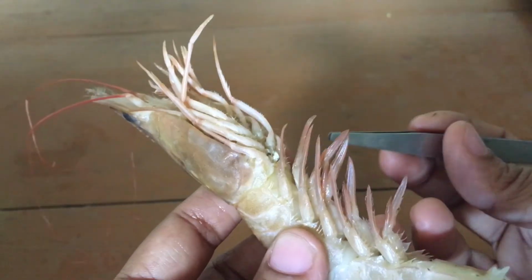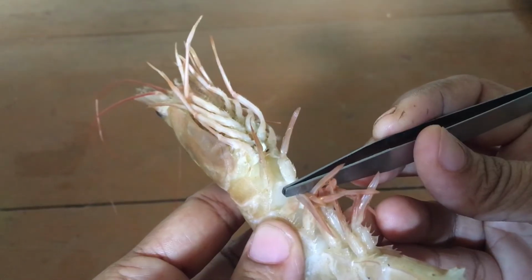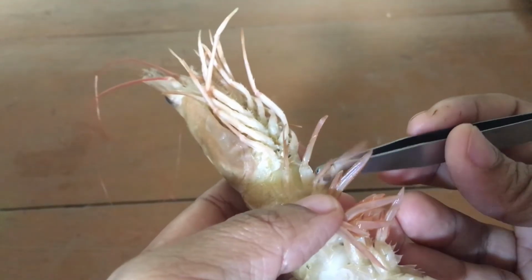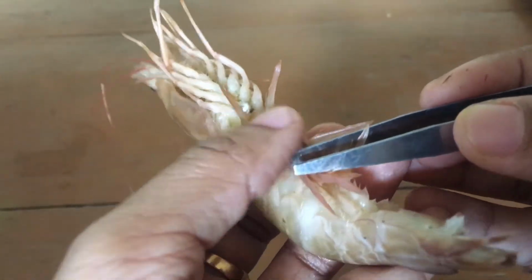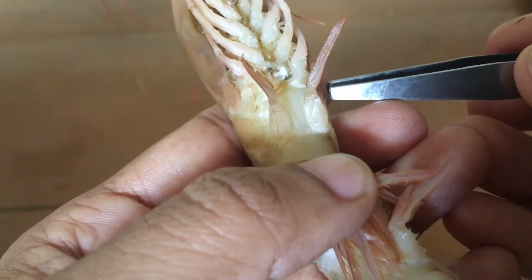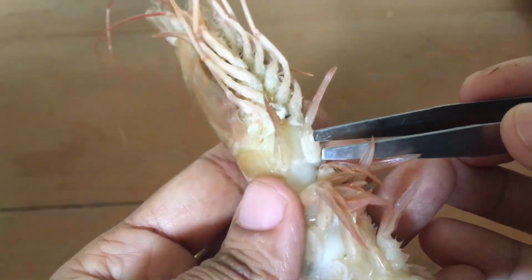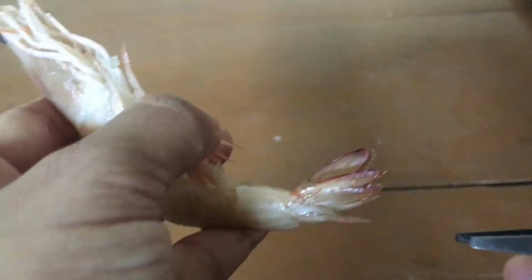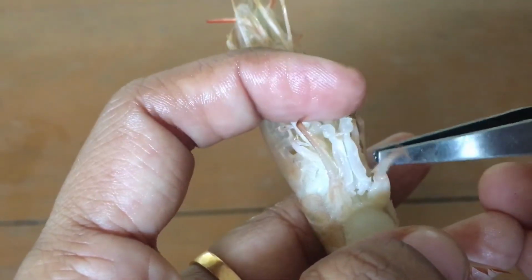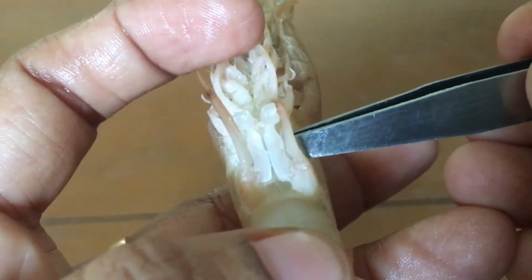In the first pair, we know there is one difference between male and female. In the case of female, we have learned that the first pair of abdominal appendages is free. As we can see, this first pair is free, so we clearly find that this Penaeus is a female one. Very clearly, we can see the first pair is free here. For your better understanding, I will show the case of male also. This is a male Penaeus. Here we can see it is joined, forming the copulatory organ. Its name is petasma.